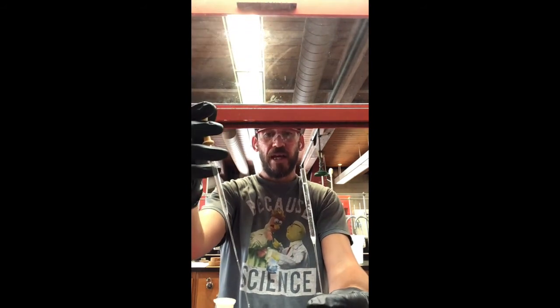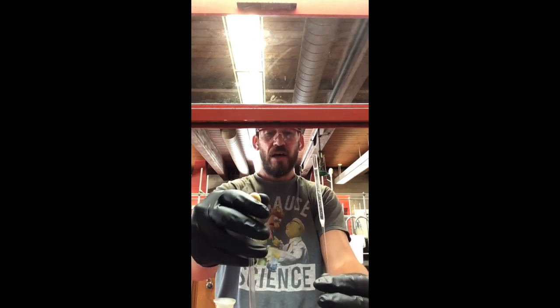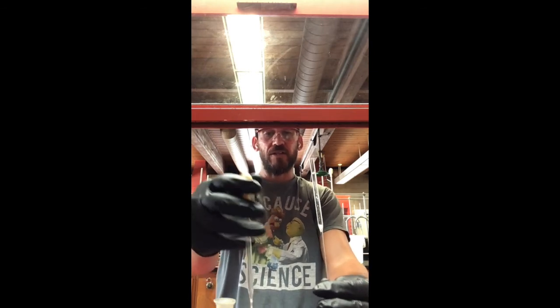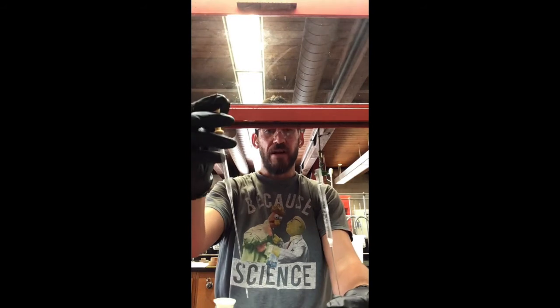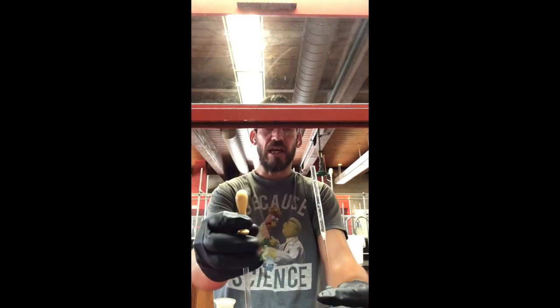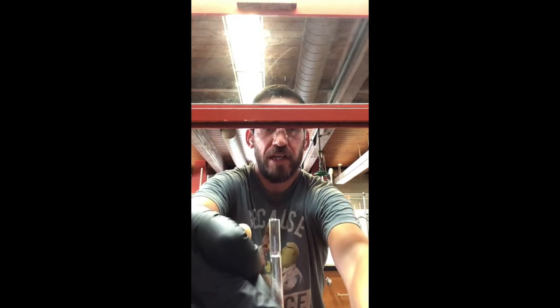But by putting that cotton in this pipette, what I've done is created a filter, and it does not allow anything but the solution, the methylene chloride caffeine solution, to make its way through, and now I don't have to be very careful. So super awesome, very useful, very easy to make too, right? It'll take some practice to figure out how much cotton to put in there, but you'll get that pretty quick.